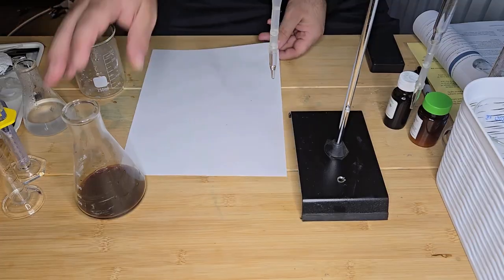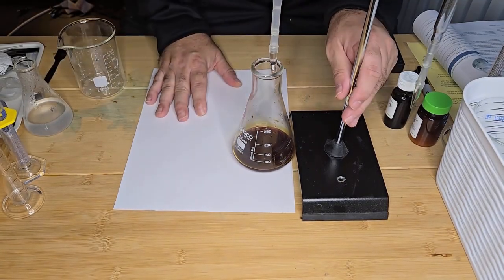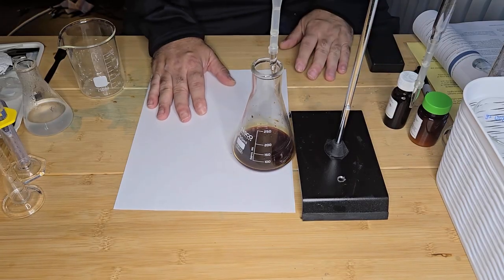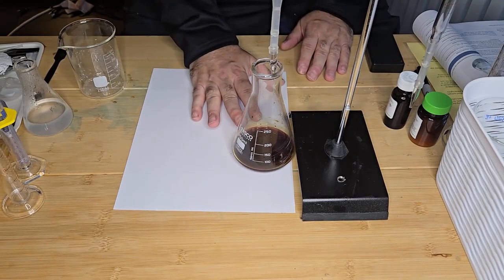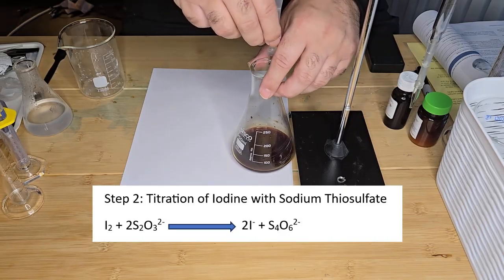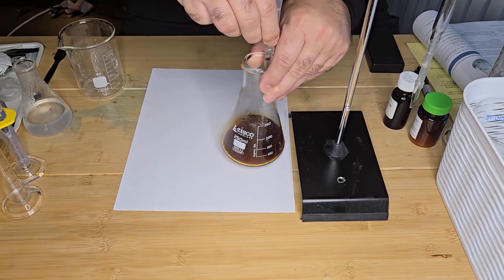So what I'm going to do is get my iodine flask. And what I want to do is titrate, or add my titrant, until the brown color goes to a very pale brown. And then I'm going to add my starch indicator. So I'm going to start and add my titrant now, all the while keeping it mixing.